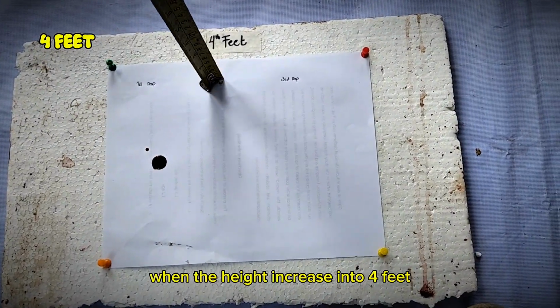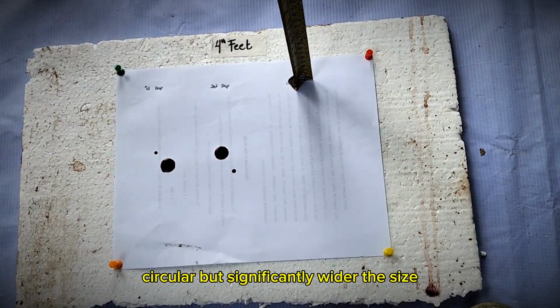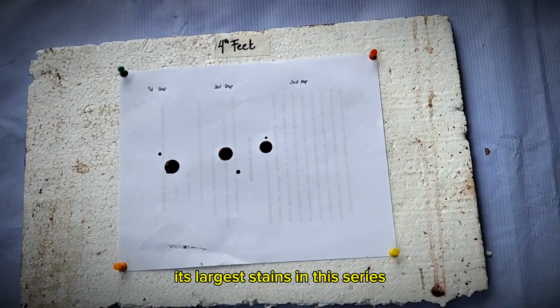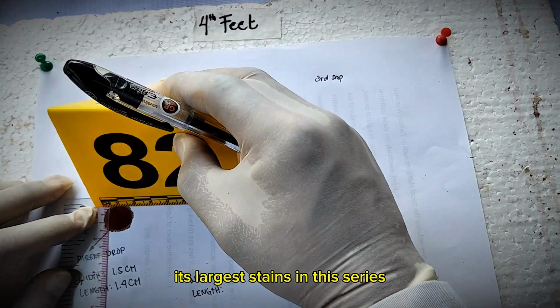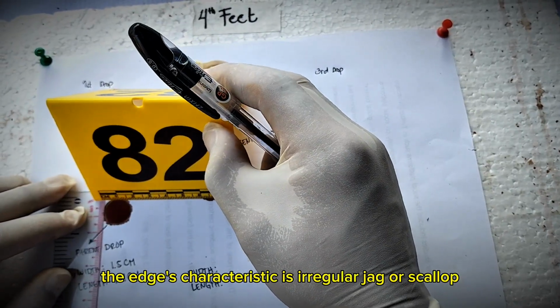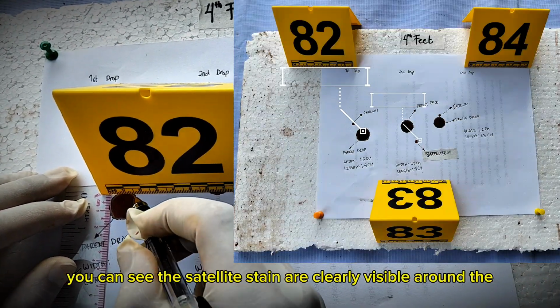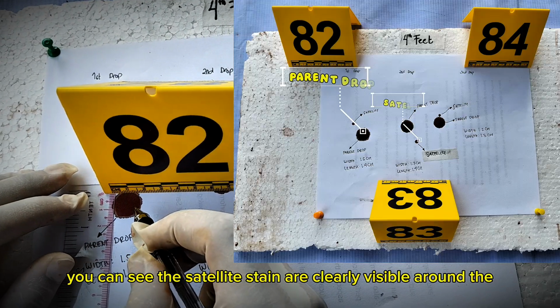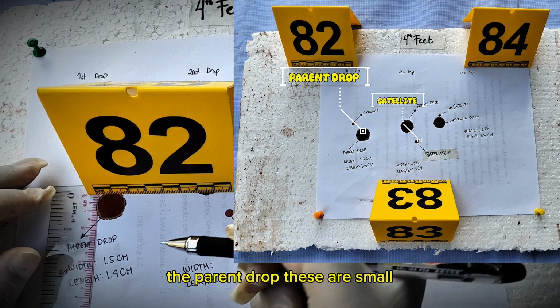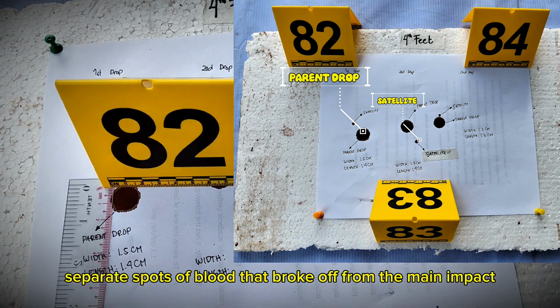When the height increases to 4 feet, the shape of the blood on the surface is circular but significantly wider. The size is the largest of the stains in this series. The edge characteristic is irregular, jagged, or scalloped. You can see the satellite stains clearly visible around the parent drop. These are small separate spots of blood that broke off from the main impact.